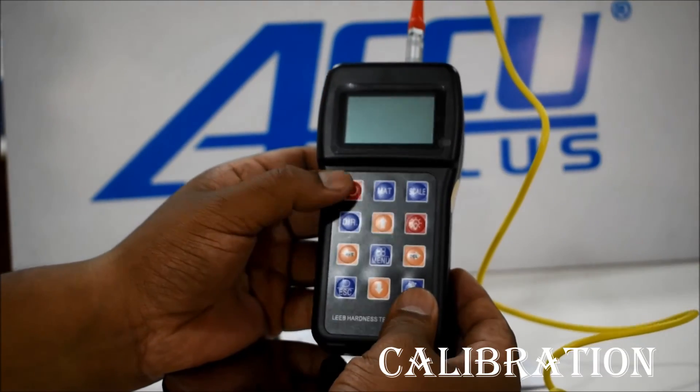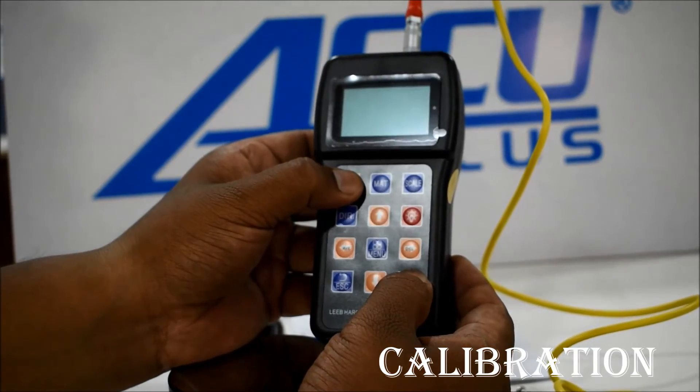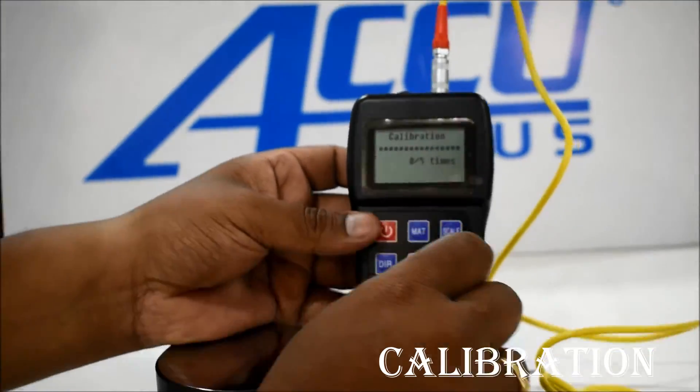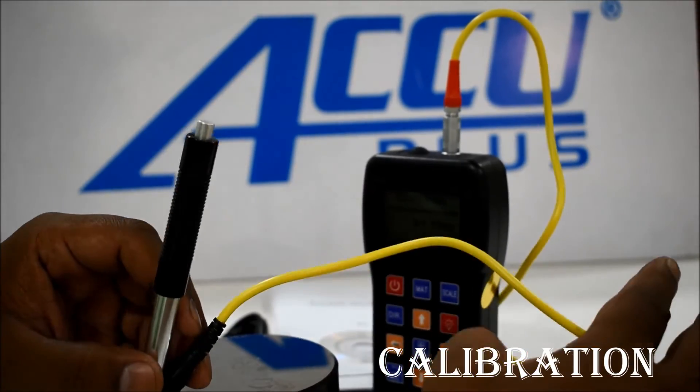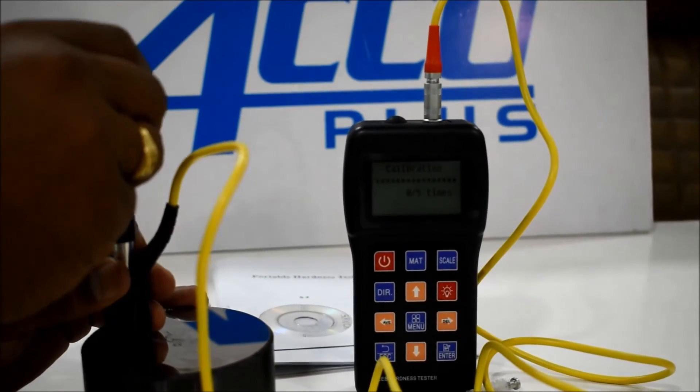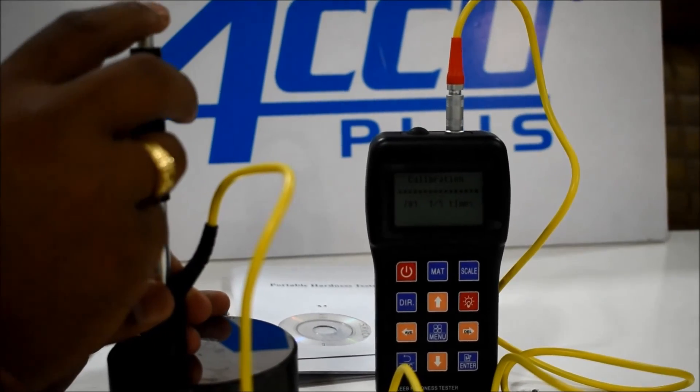We will go to calibration mode by pressing both the enter key and on key at the same time. In calibration, take five readings on a single block.